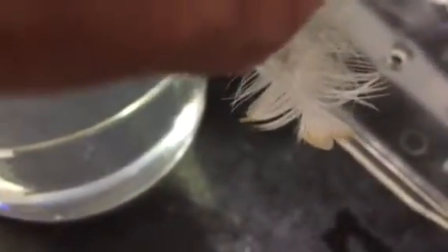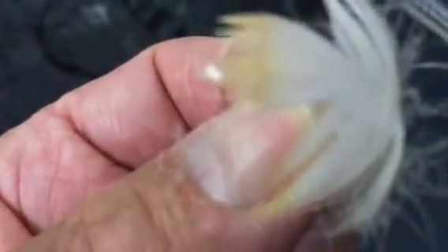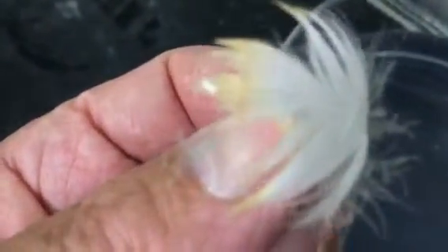Now I'm going to pick the other one out, and you'll see for that one the feathers are still as they were, a little wetting, but not really much wetting at all. And these are two feathers that came straight from the adjacent parts of the duck. So you see in this case the feather is not wetted. Okay. In this case it's not wetted.